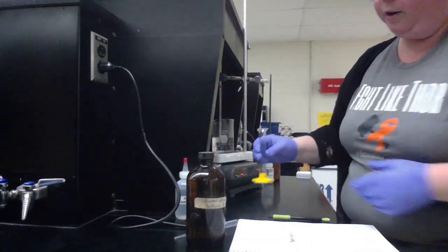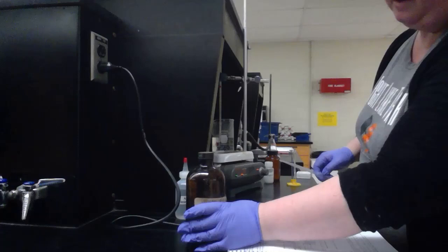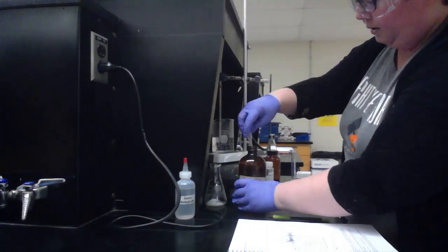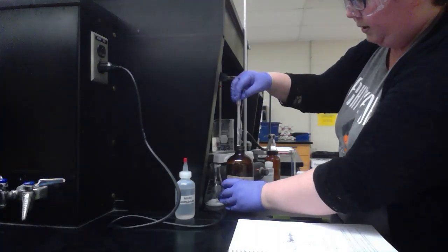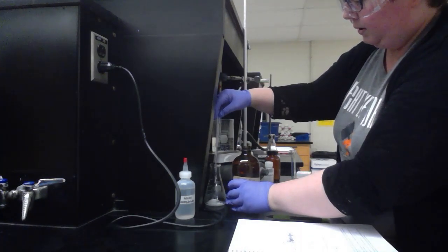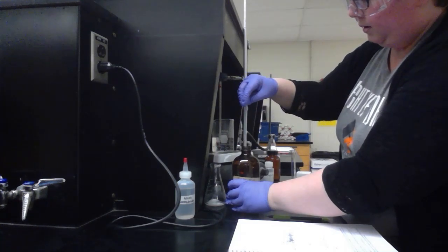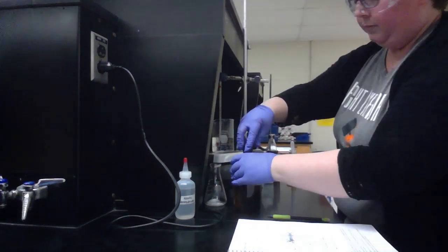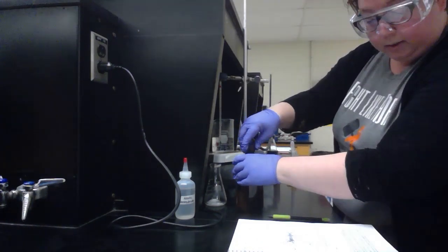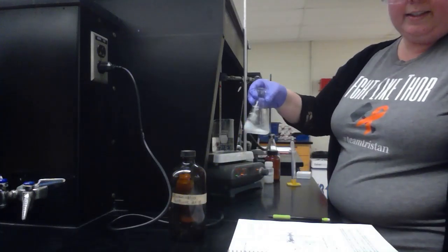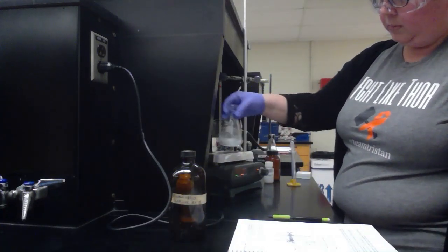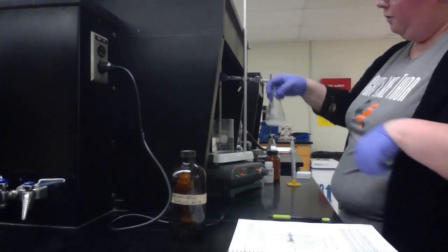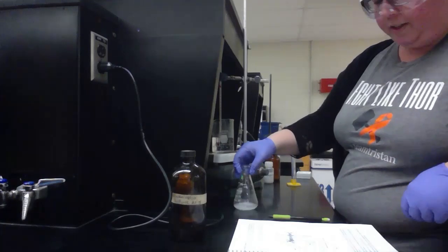I'm going to add that to my Erlenmeyer flask and then take four drops of the concentrated sulfuric acid very carefully. I'm going to swirl these together to mix them and then place that in my hot water bath, and it's going to sit there for 15 to 20 minutes.